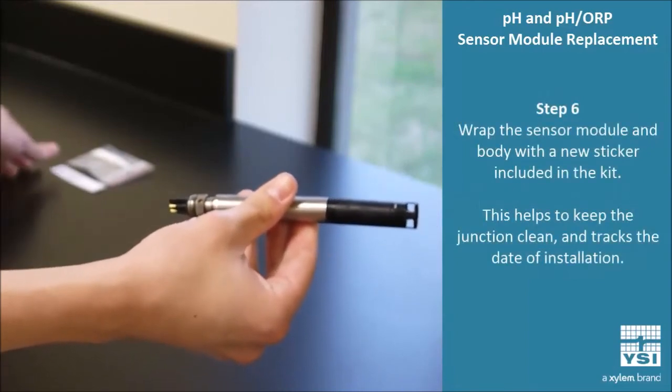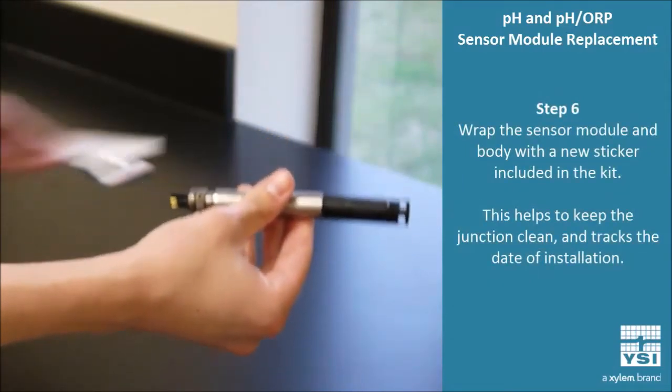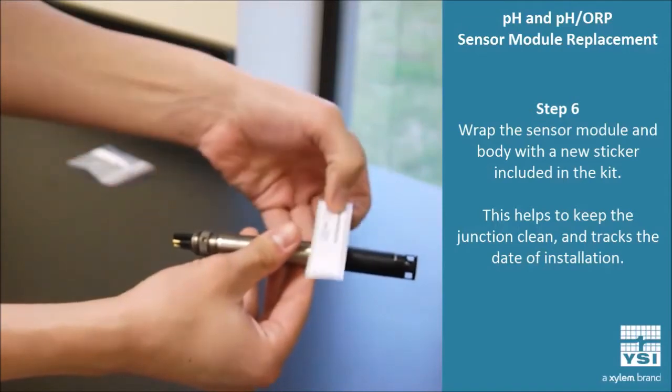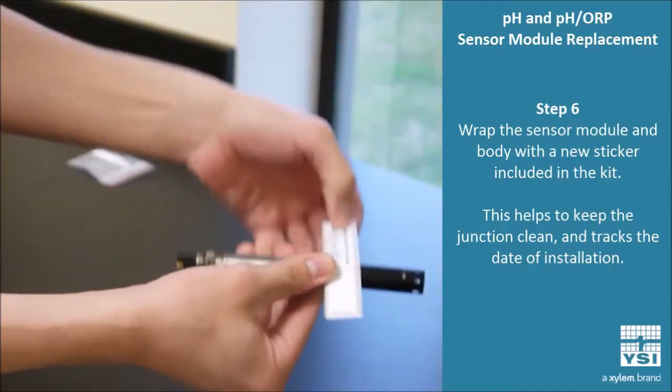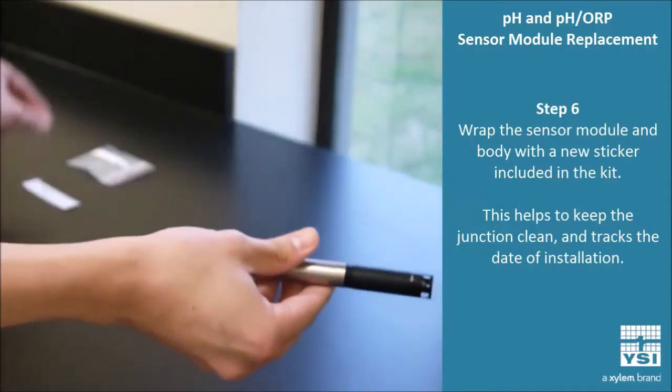The final step is to apply a sticker with the date of installation and just wrap that right around and you're finished.